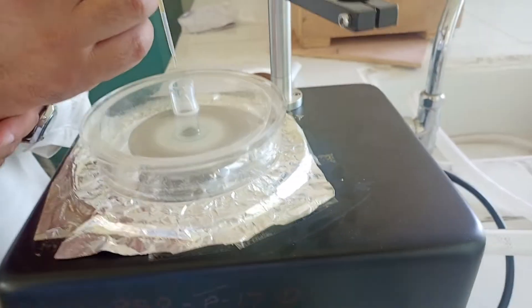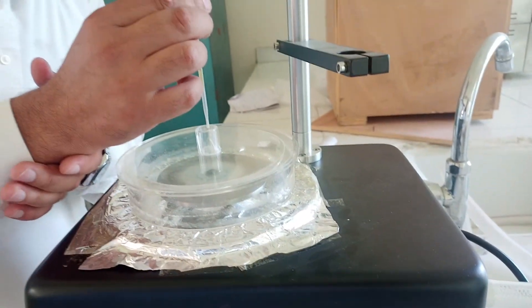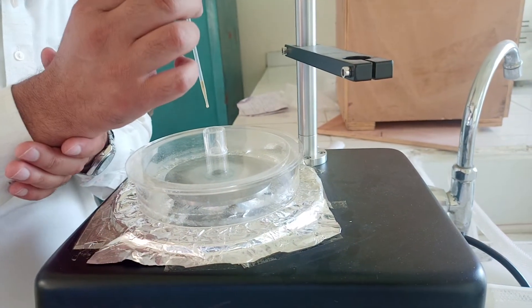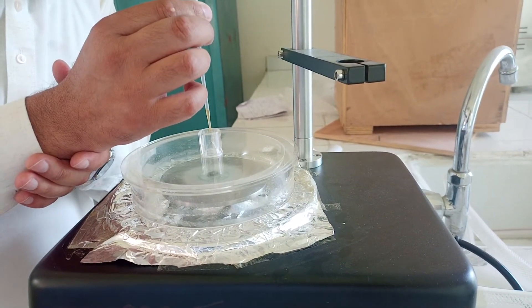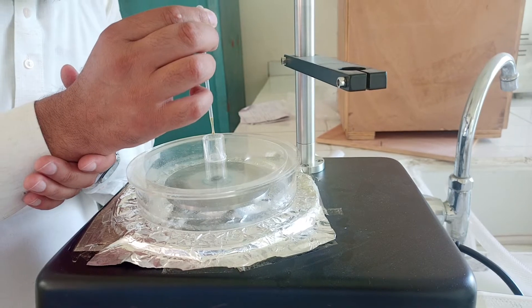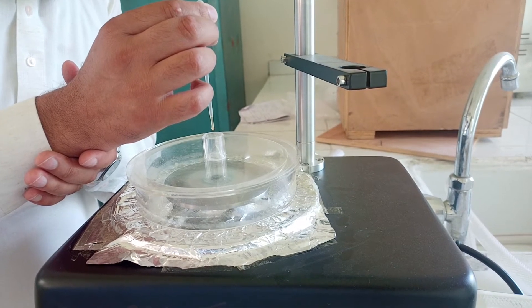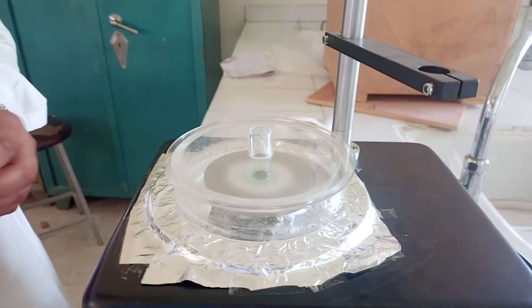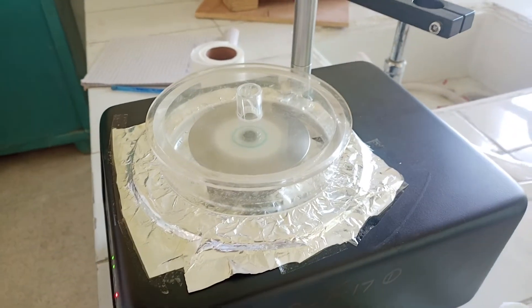Now this is our second cycle. I am going to add a little bit. I am going to add one minute.